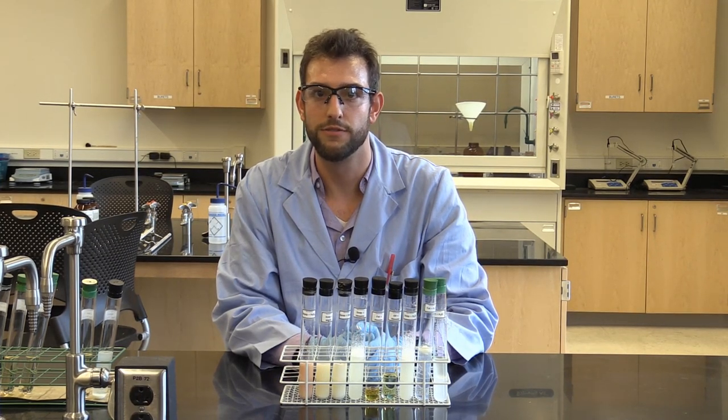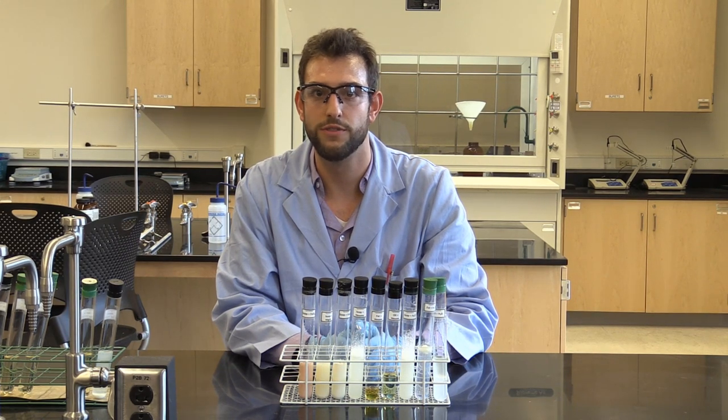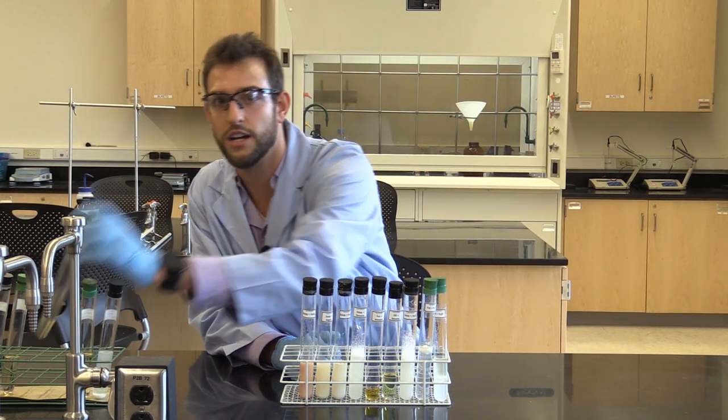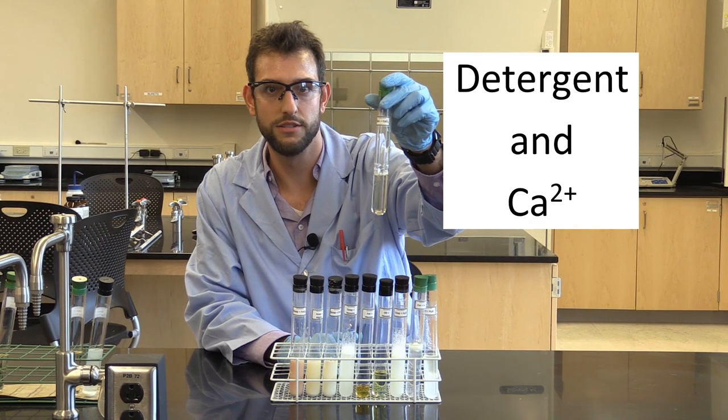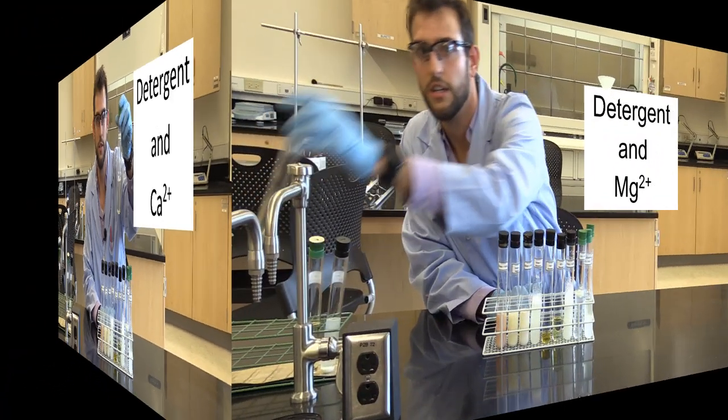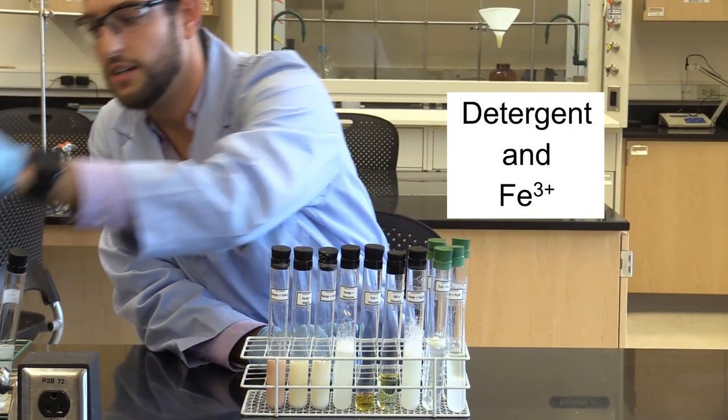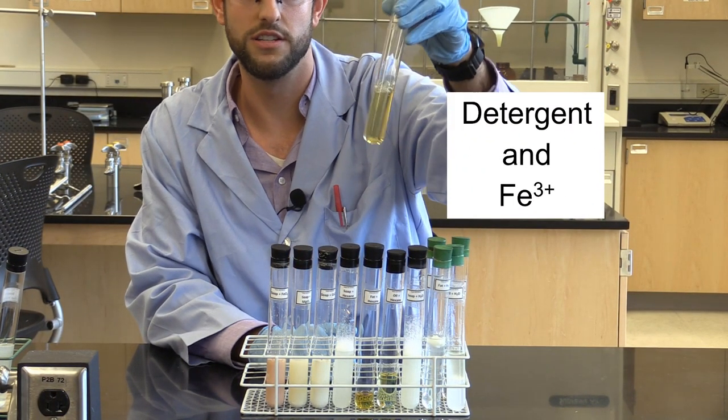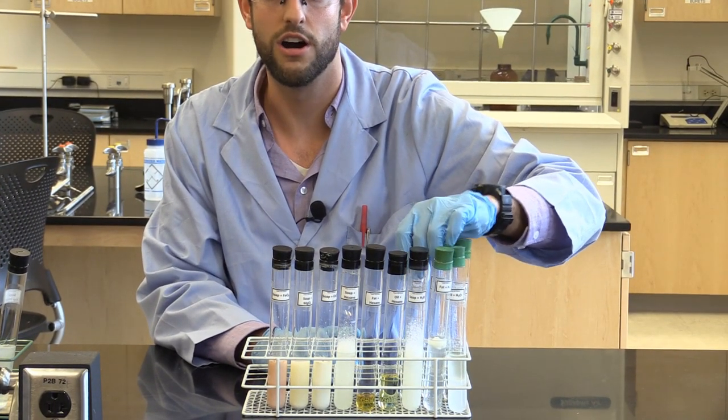Supposedly, if we try a different solution, say a detergent solution. The detergent can fully solubilize all three of these ions. So this is with the calcium. This is with the magnesium. And then here is the iron. As you can see, all three were soluble.